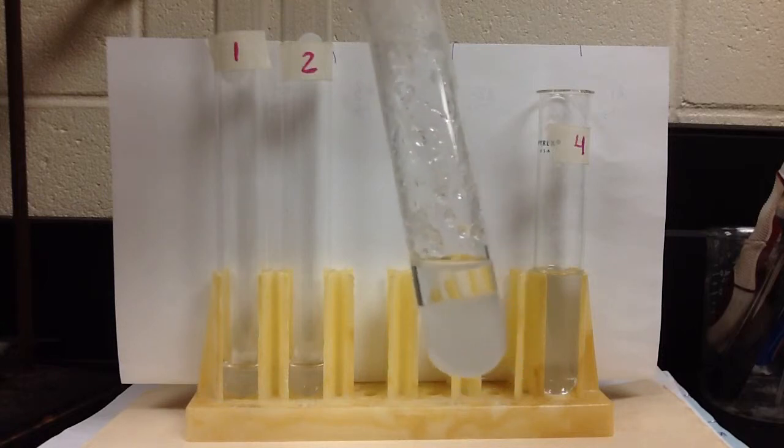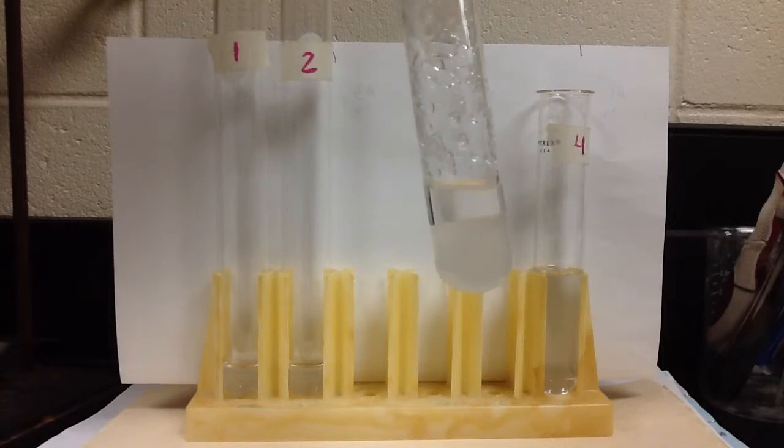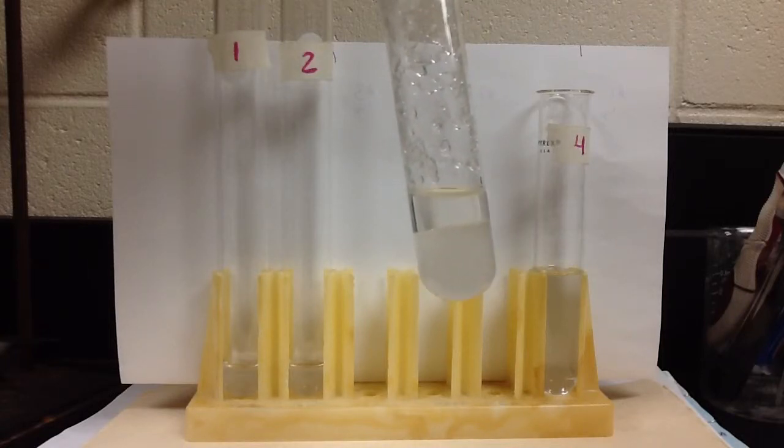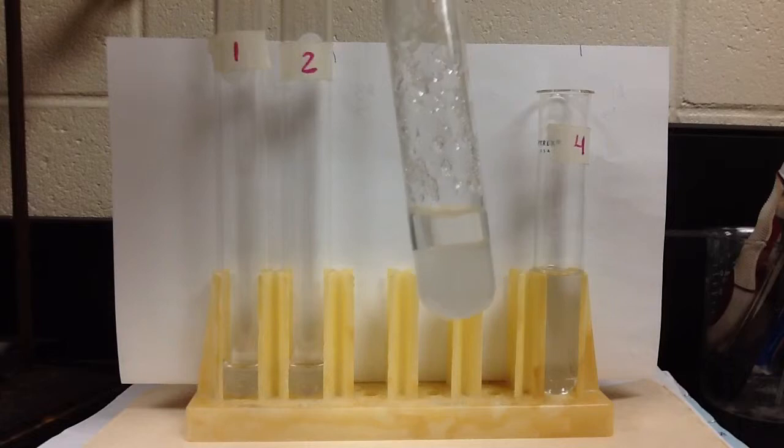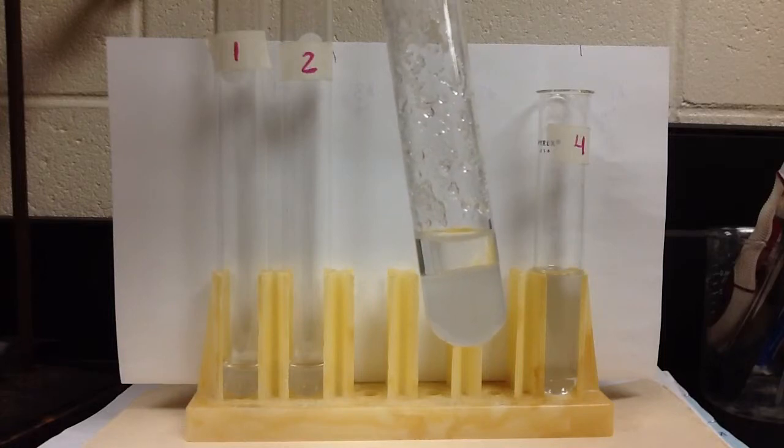So then what we do, we see we have two layers. We have a layer of solid and a layer of liquid. So after shaking for three minutes, we're thinking that the liquid that's left in there is a saturated solution. We're thinking that liquid has dissolved as much as it can at room temperature, and it can't dissolve anymore.